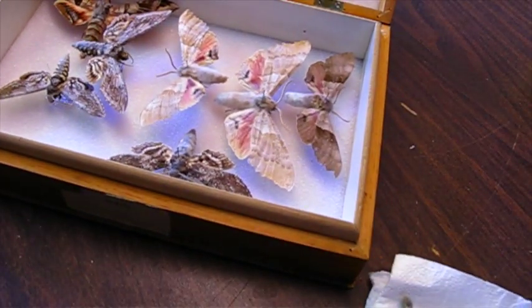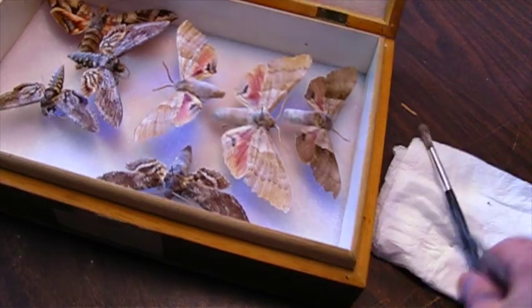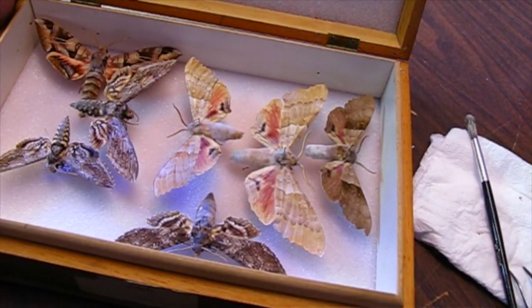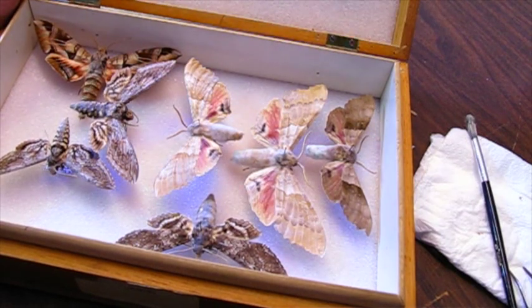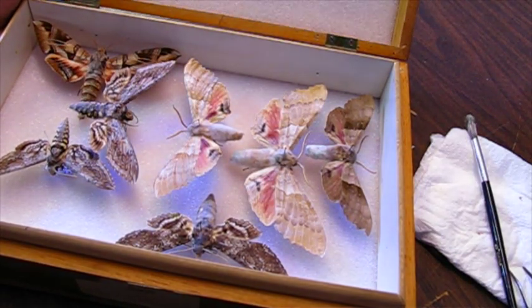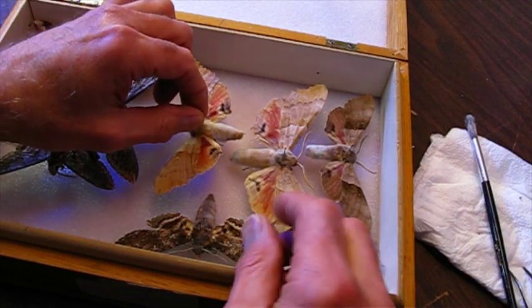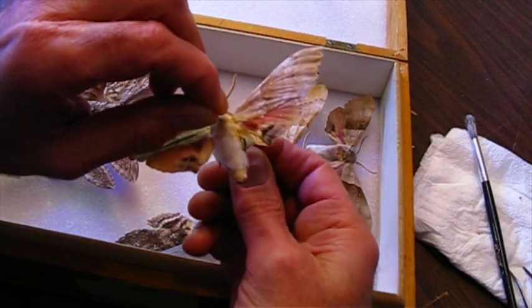Today I'm going to demonstrate a technique for removing mold from specimens. Some of my insect drawers were exposed to humidity, and a few of them developed mold on the abdomen of these moths.